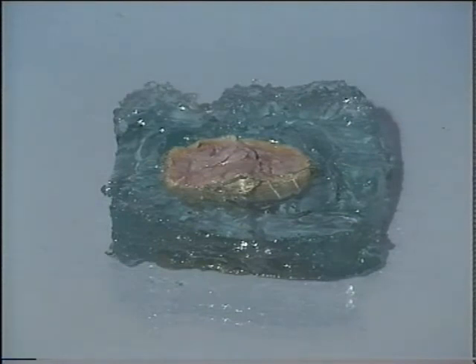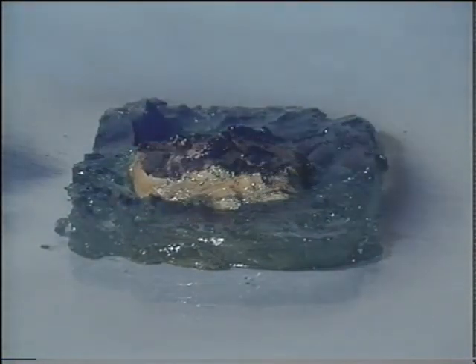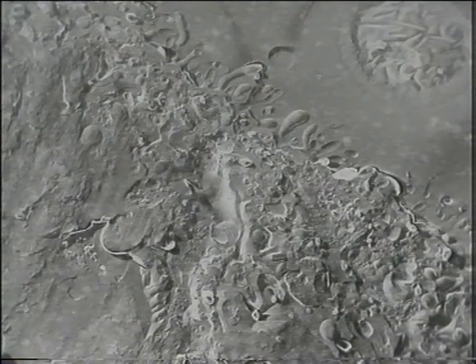In the case of freeze etching, the specimen is also frozen, but the temperature is then raised slightly to allow a thin layer of ice to be removed by sublimation. Part of the specimen then stands proud of the surrounding ice. This is shadowed with a layer of heavy metal, and then has a strengthening layer of carbon added to it. The specimen is dissolved away with sodium hydroxide, and the carbon replica is recovered on a copper grid and examined in the microscope. This technique gives quite distinctive results, as in this micrograph of a piece of placenta.